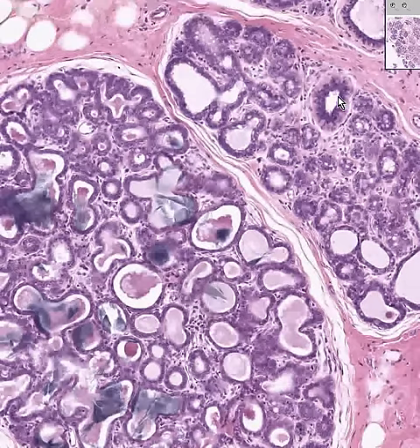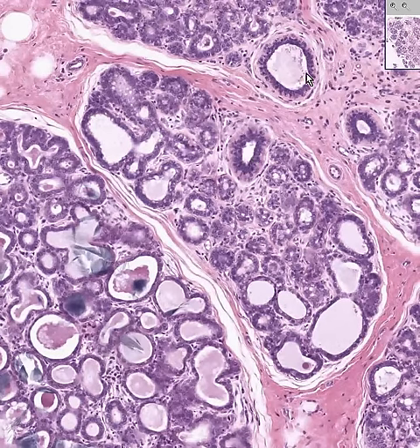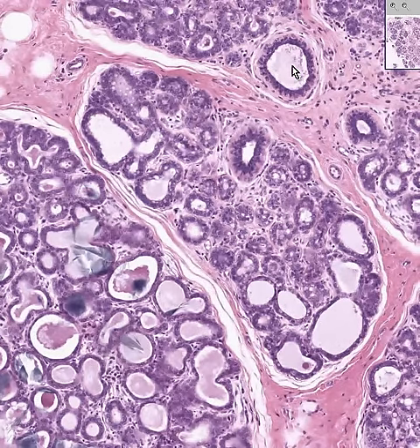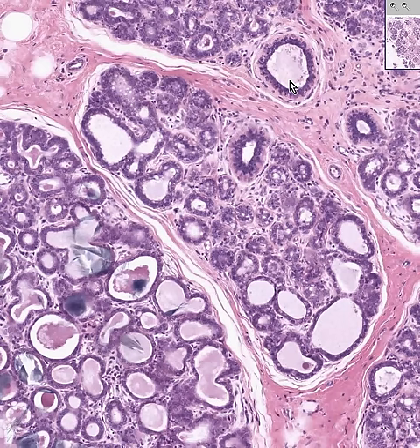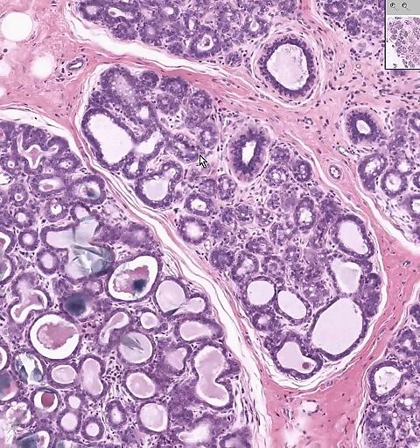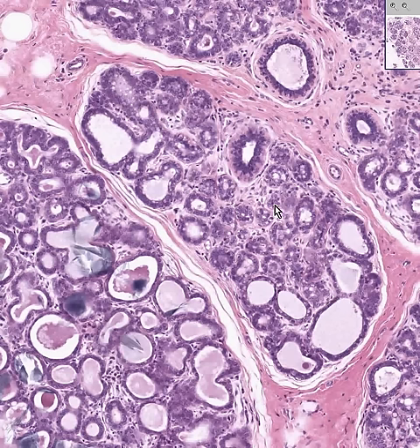We can see a duct inside one of these lobules as well as a duct at the periphery of the lobule. Remember, the duct is just strictly transporting the material, whereas all of these acini are actually making the juice.